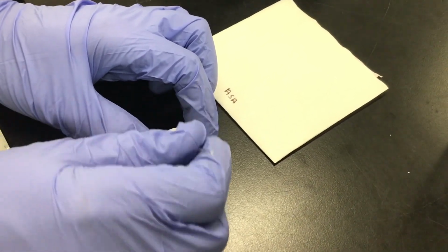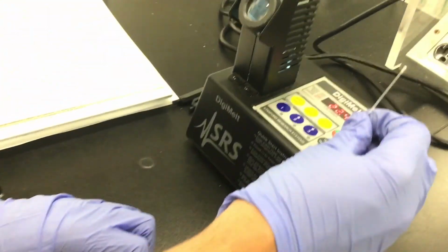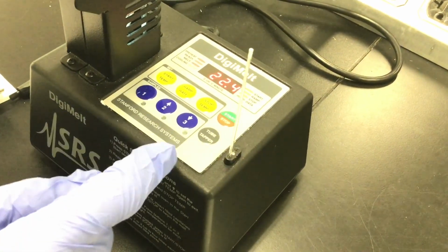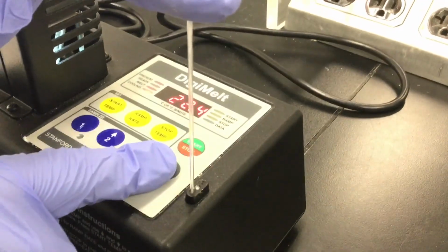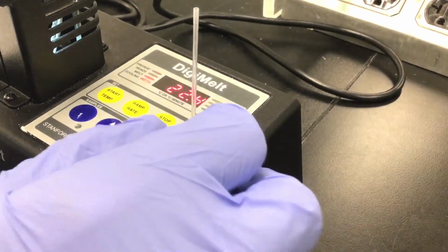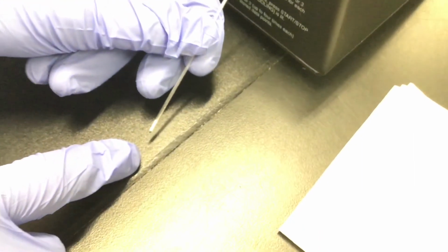So we've got a couple different ways to go about helping us do that, especially when you've got a solid that's greasy. For example, cholesterol tends to stick, and we'll see that in the other experiment. But this is called a tube tapper, and it literally just taps the tube and vibrates the tube. You can see like that. And it's doing the work for us, and now we've got just a perfect amount of solid at the bottom closed end part of the capillary tube.